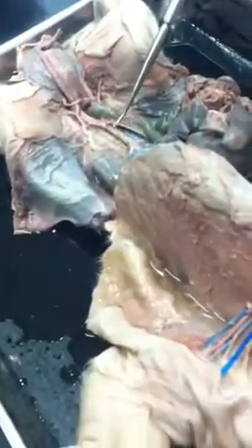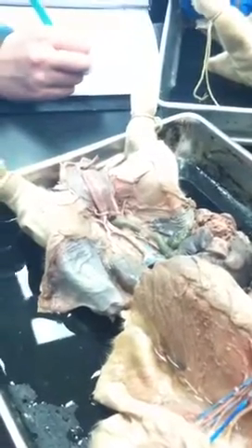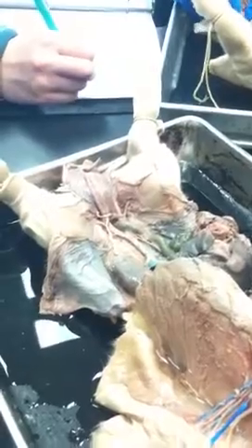Okay, then you should have, I think he told me that, here it is, going up the large intestine. Then the one going to the gonads, I think it broke on his. This one going up to the gonads. They should be one there, that one. You can see that one. It's not heading to the large intestine, but it's going back here. That's the gonadal.